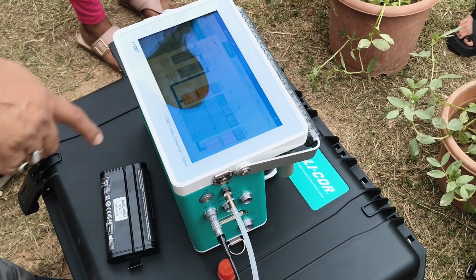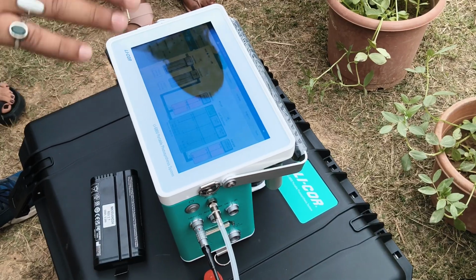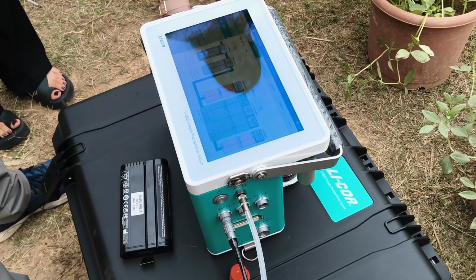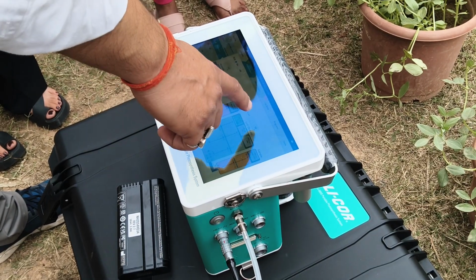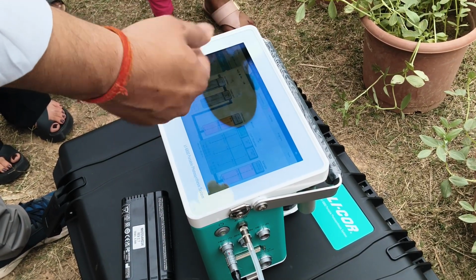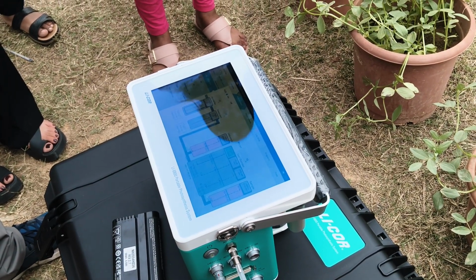Then H2O. So in H2O you can check the relative humidity range. Relative humidity for the plants, fix at least from 50% to 75% or 70% of humidity. In that range, the plants can do photosynthetic activity. If it is less than that, there is a chance of stomata closing. So you can fix this humidity at 50%, or you can also check as per the environment condition. If it goes up to 60, 65, then you can fix 60 to 65 also. So that will help the plant to be in the same environment condition and it can do measurements as early as possible.